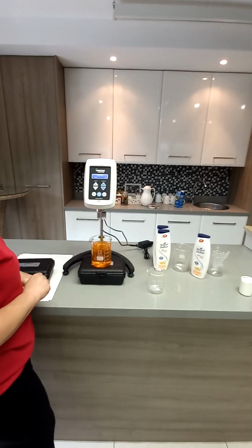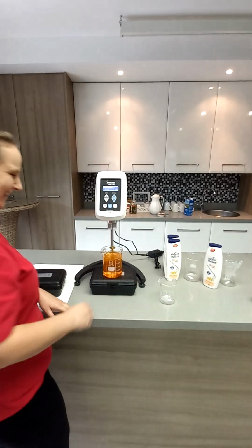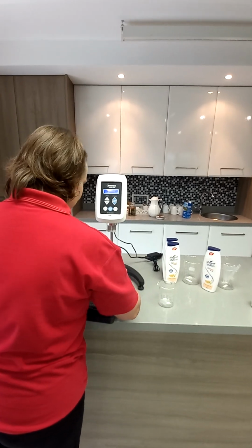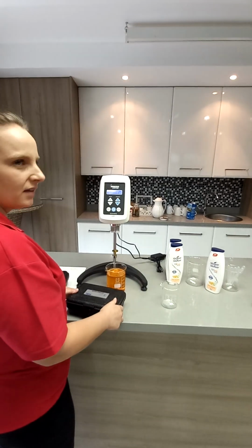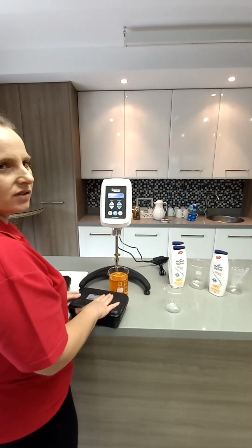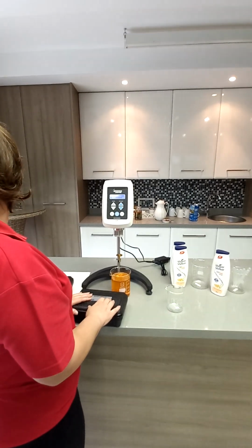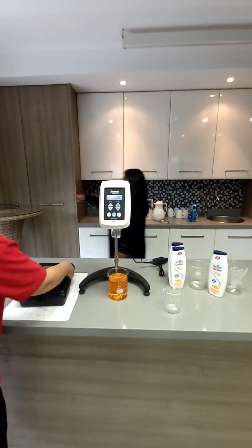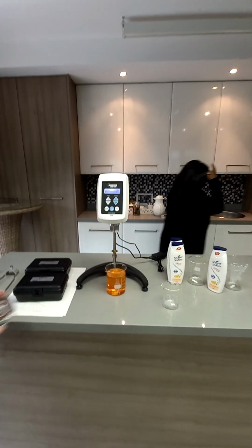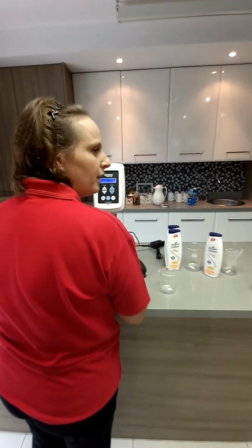I can actually add more sample, that would also help. What about a ream of paper? Or is that too much? It's too thick. Otherwise, I just use the case. Use that glass, it will be more sturdy. It's more sturdy, a flatter surface. This is very technical lab stuff. We're good. Thank you.